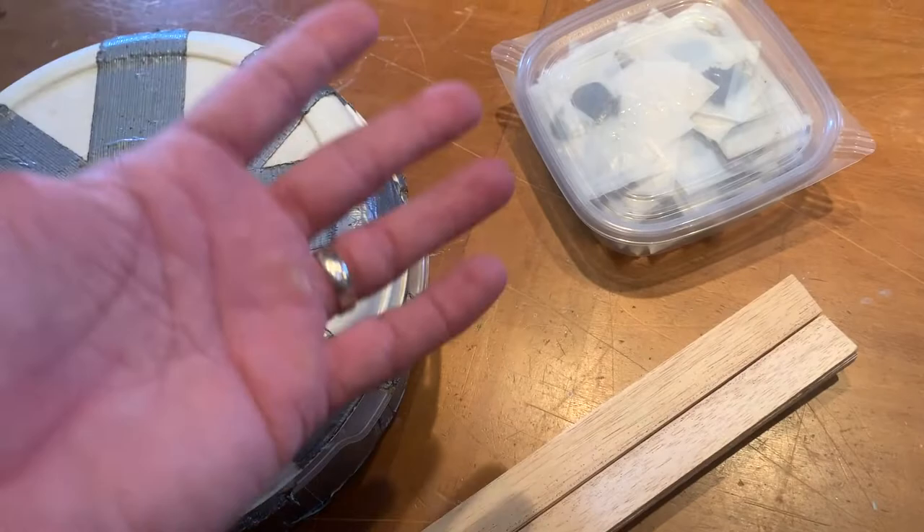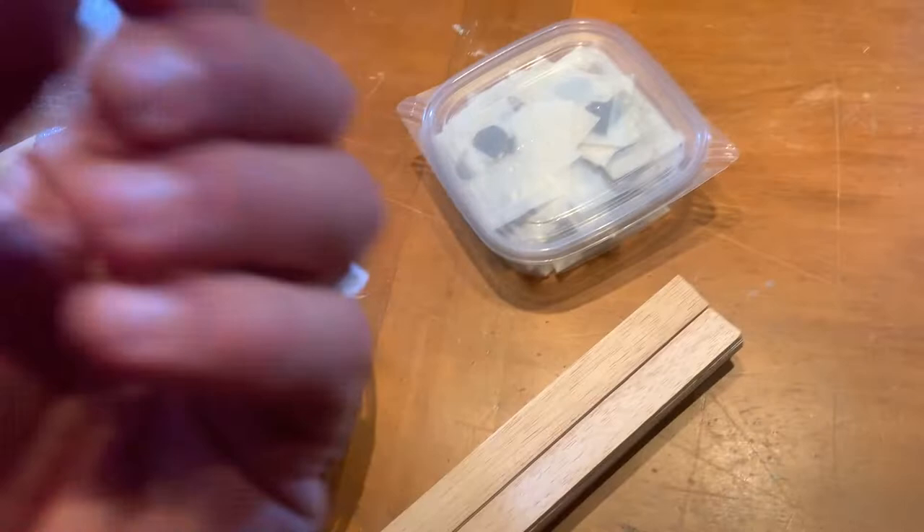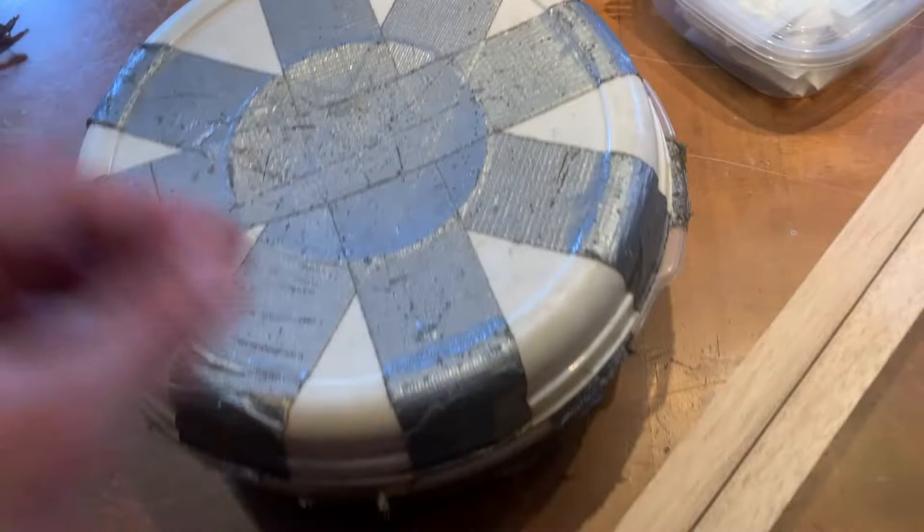But you lose flexibility, you can break antennas, you break legs, and water dries out a lot faster than their natural body fluids. So I always typically like to mount my specimens as soon as I can when I get in from the field. But sometimes it's not possible, and we are going to show you the ins and outs of a rehydration chamber.